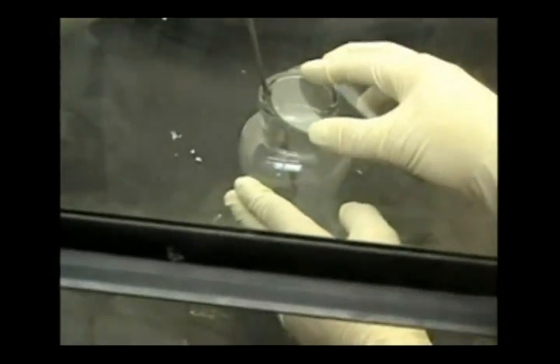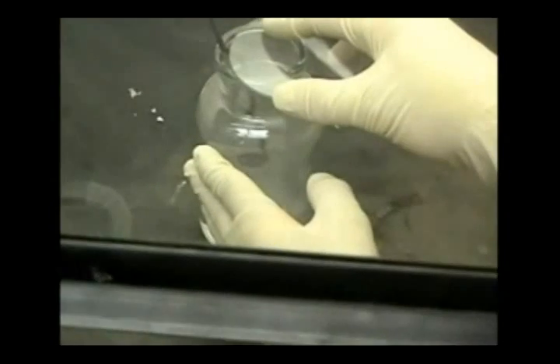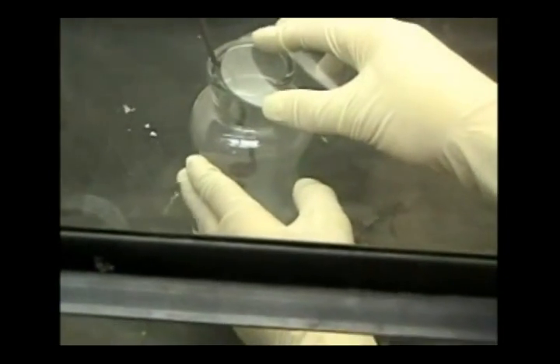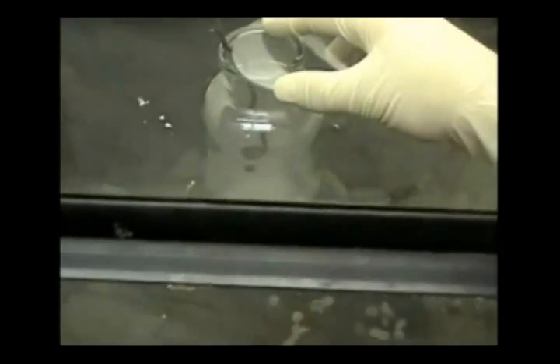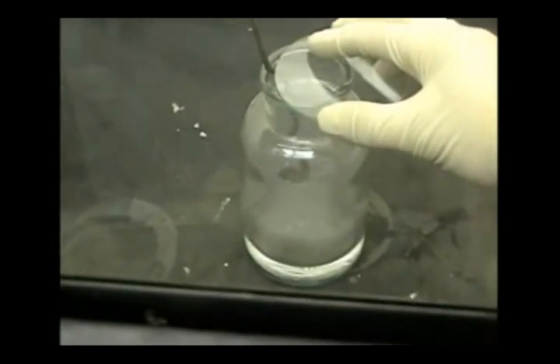When I place my hand on the glass bottle, the bottle has become cold. This signifies an endothermic reaction.